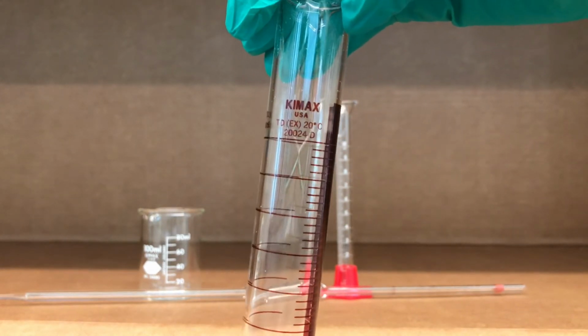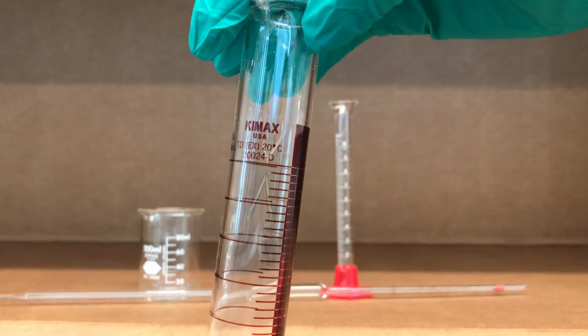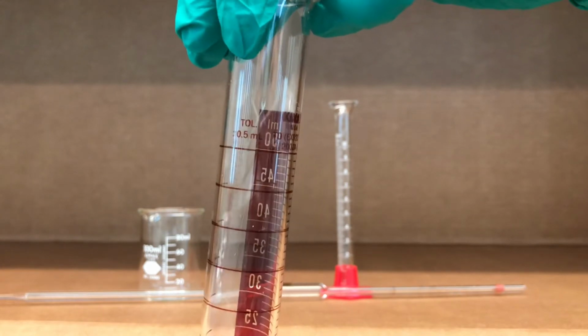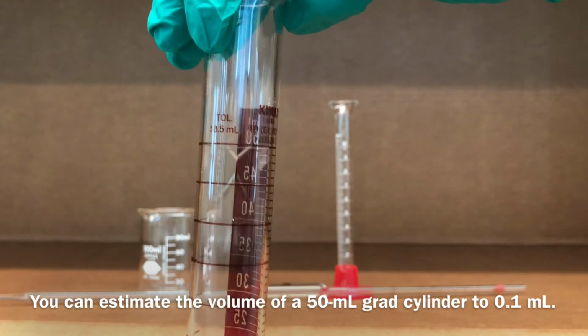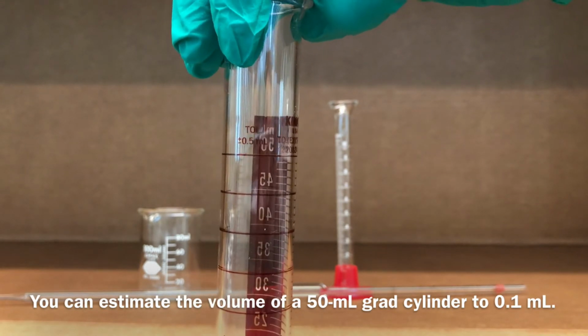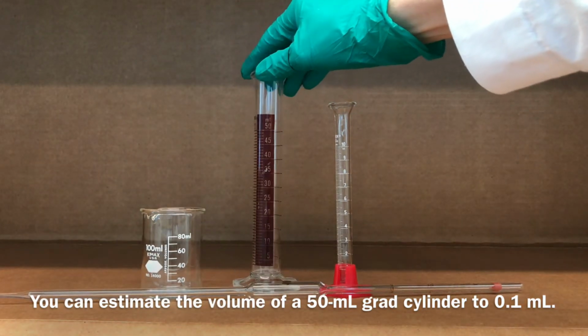In fact, on the side of the graduated cylinder, it shows you that it measures to plus or minus 0.5 milliliters. A lot of the more accurate pieces of glassware will show you exactly what their tolerances are.